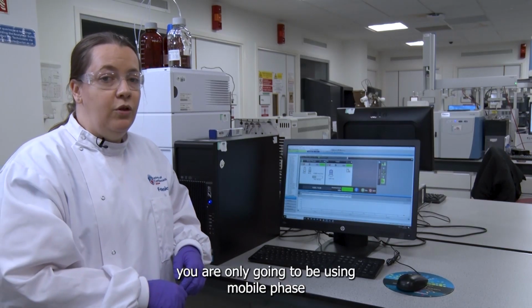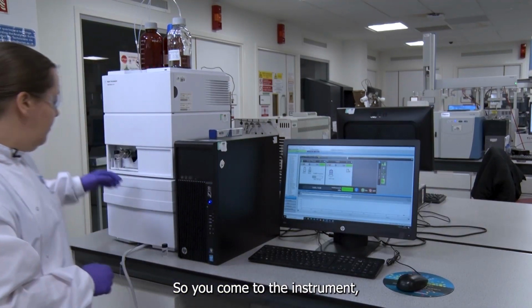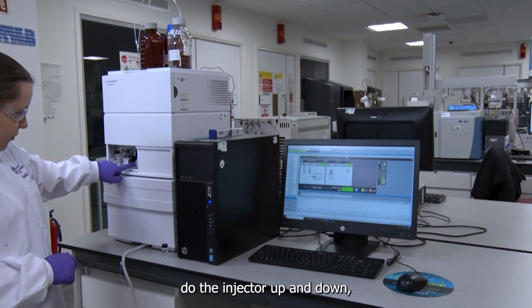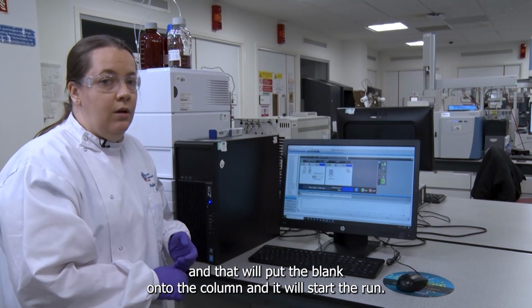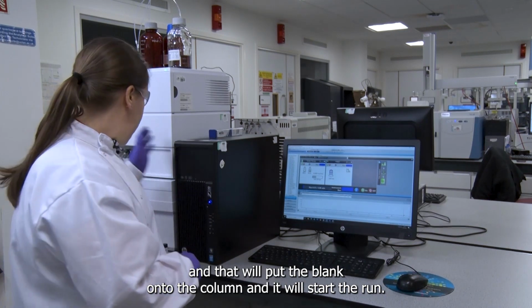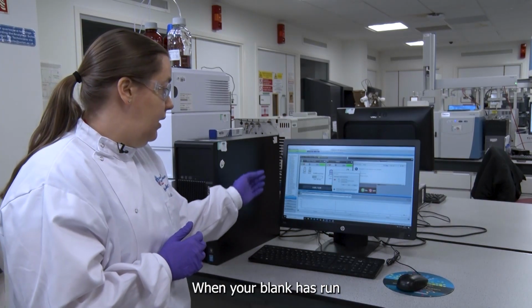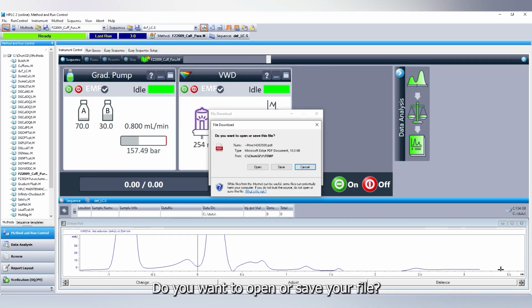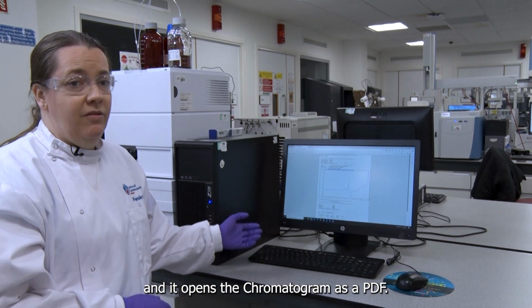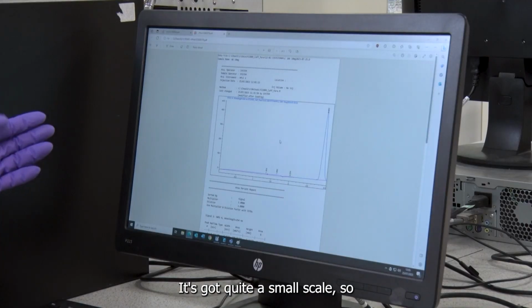For the blank, you are only going to be using mobile phase, you're not injecting anything. So you come to the instrument, do the injector up and down, and that will put the blank onto the column and it will start the run. When your blank has run, or any sample has run, you'll come up with this: do you want to open or save your file? Click open and it opens the chromatogram as a PDF. Because it's a blank, it won't be a straight line, it's got quite a small scale.